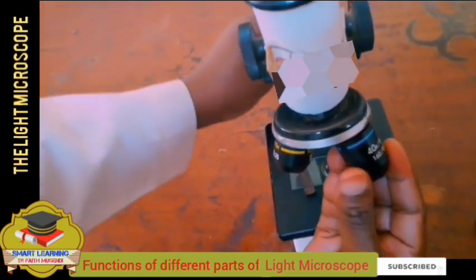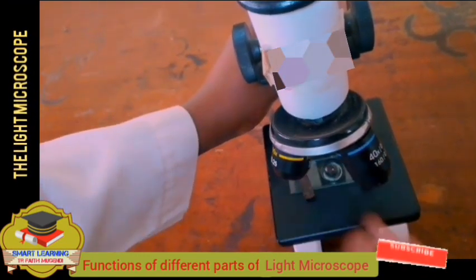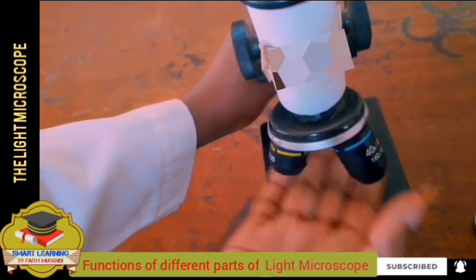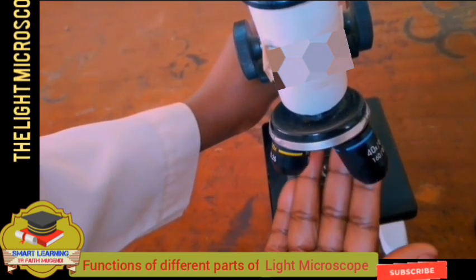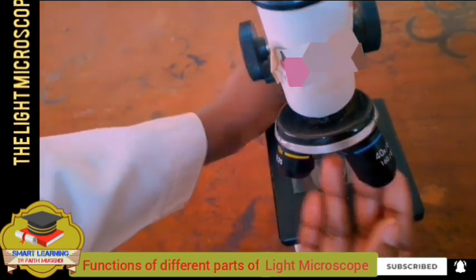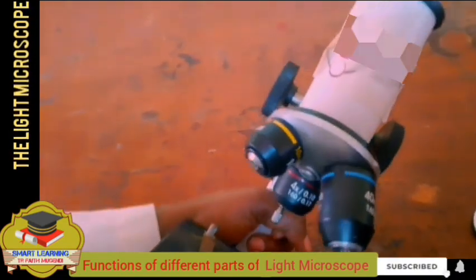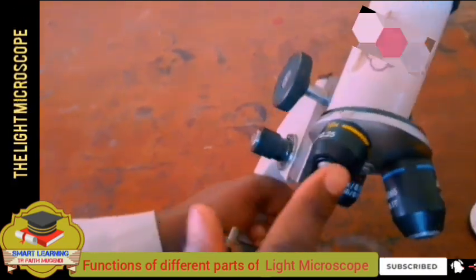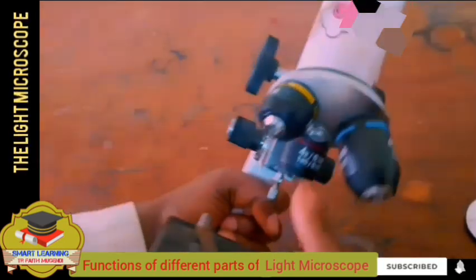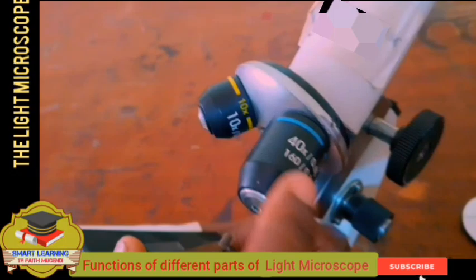Now we look at the objective. The objective is also a system of lenses located near the specimen. The specimen is here, and what is just above the specimen is the objective. There are usually three different objectives with different magnifying power. So we have this one, which has times 10, this one that has times 4, and this one that is times 40.